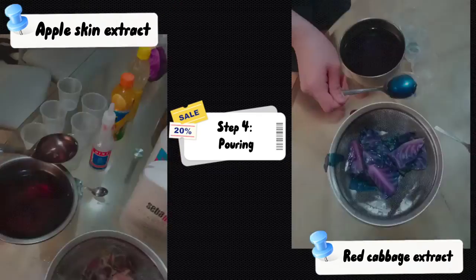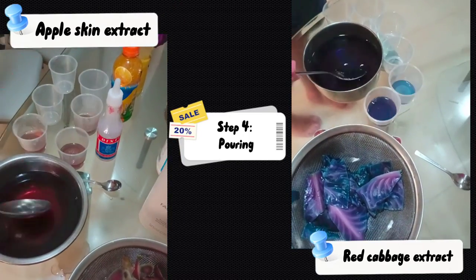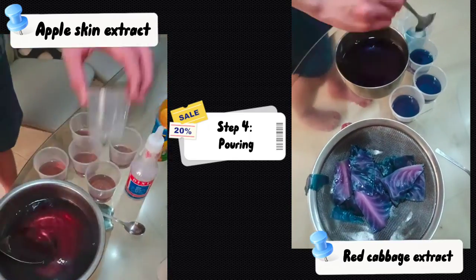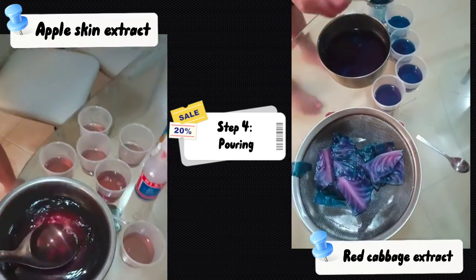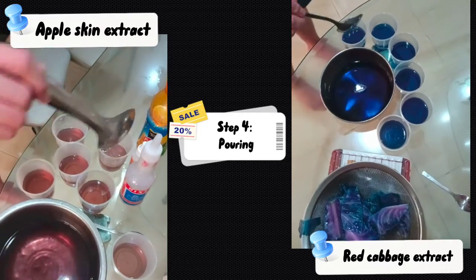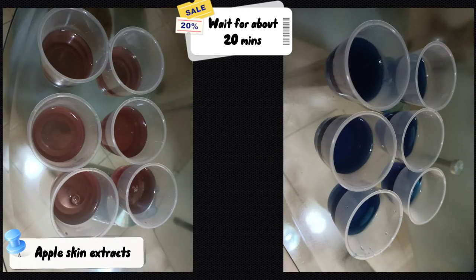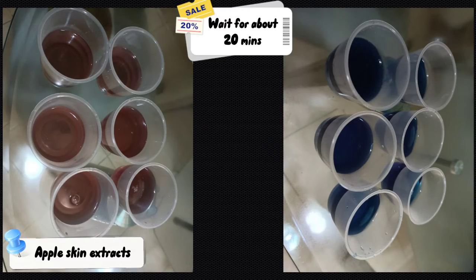Then I poured the extracts into 6 of the plastic cups with a metal ladle. I then waited for the extracts to cool for about 20 minutes.